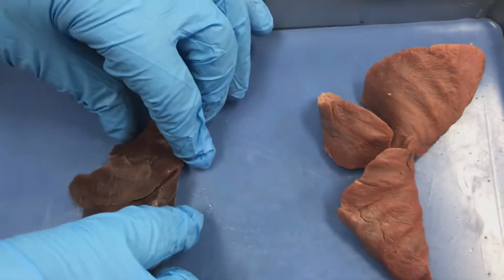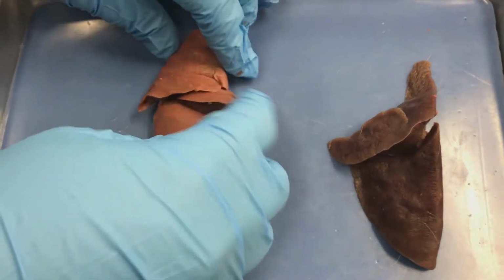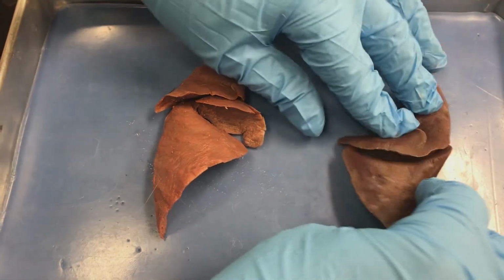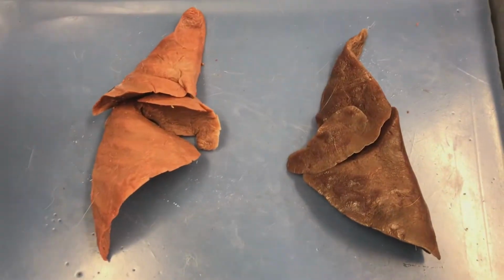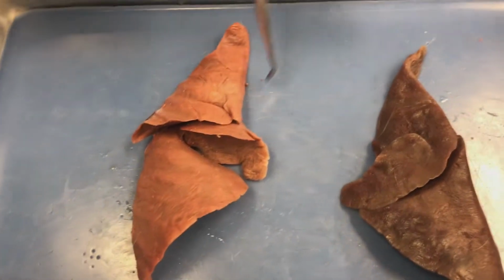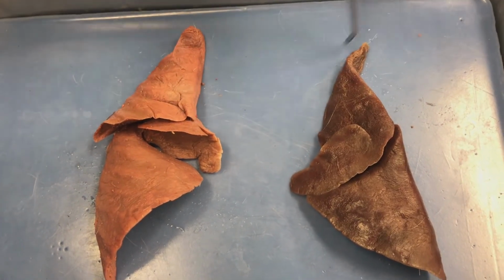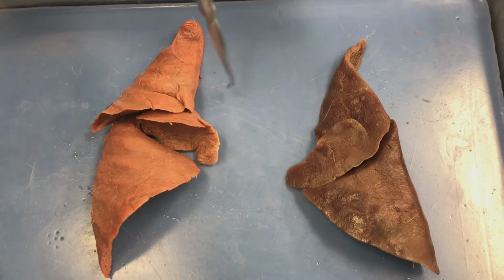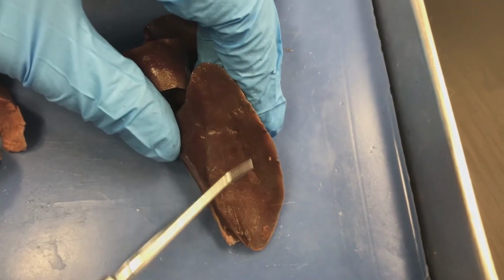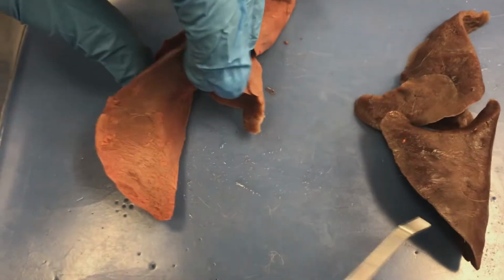So this is an example of your two lungs. This one here is the right lung. This one on this side is going to be my left. So some of the features of those lungs, both on the right and the left, you have a peaked edge to it. That's the apex, both on the left and on the right. Both sides are going to have a wide, broad diaphragmatic surface.